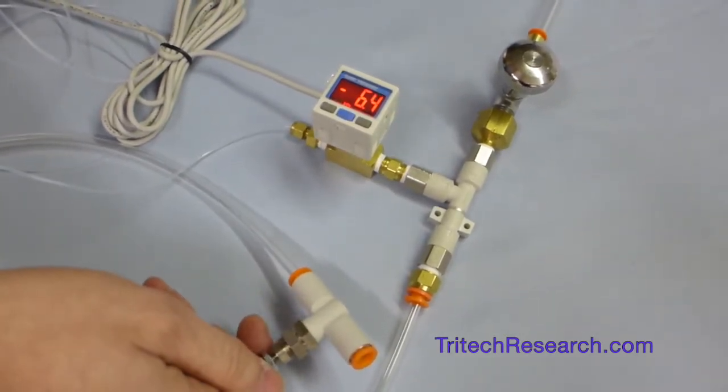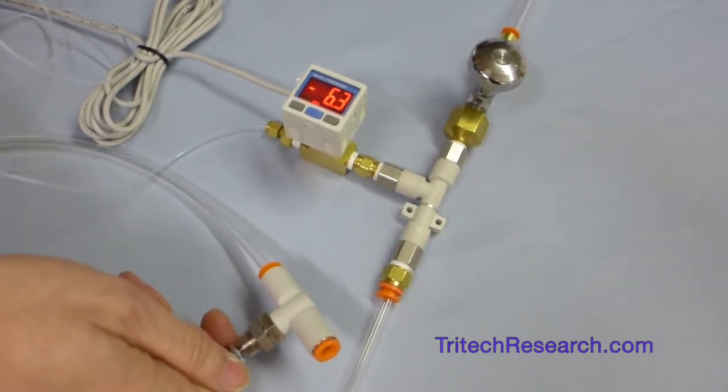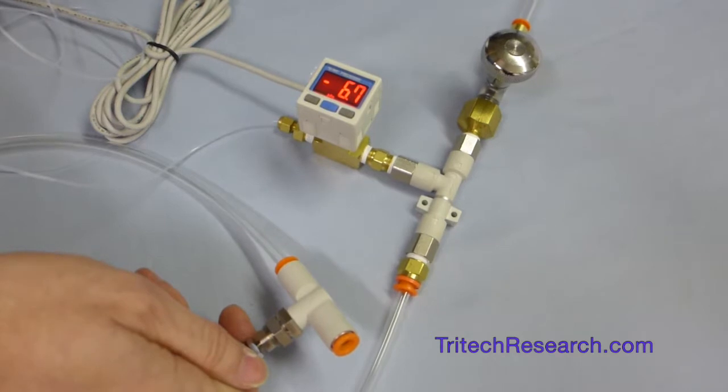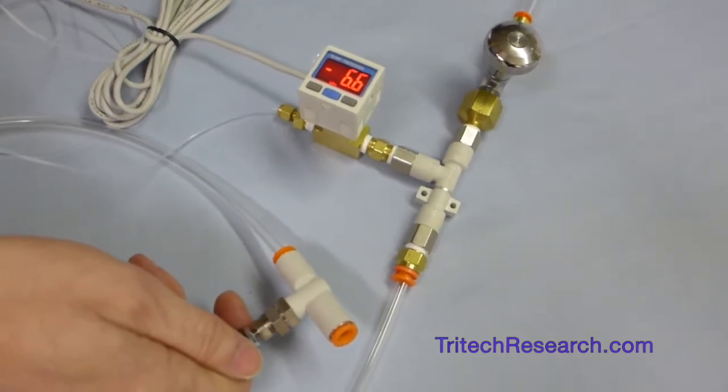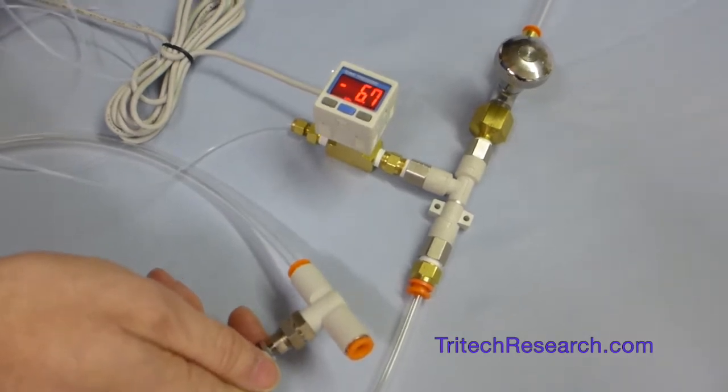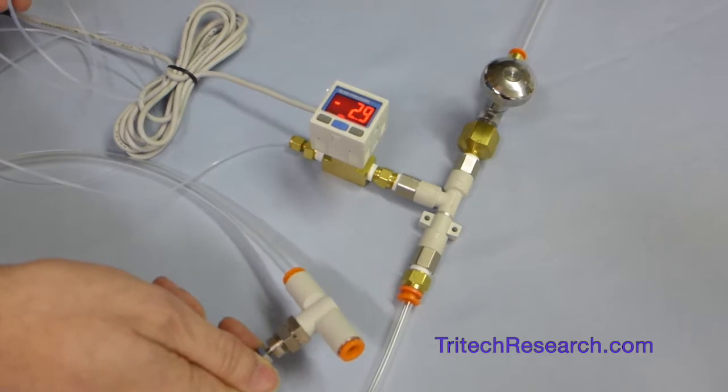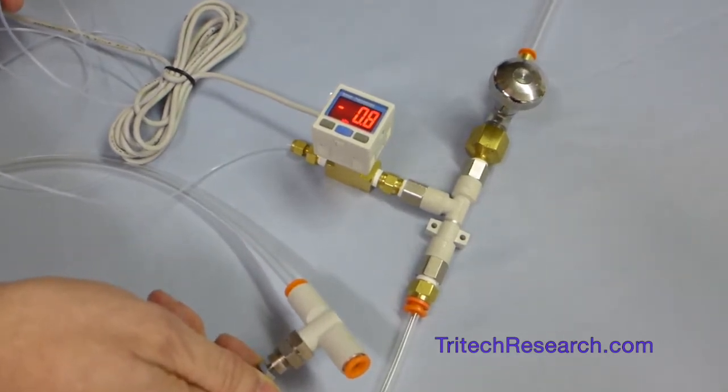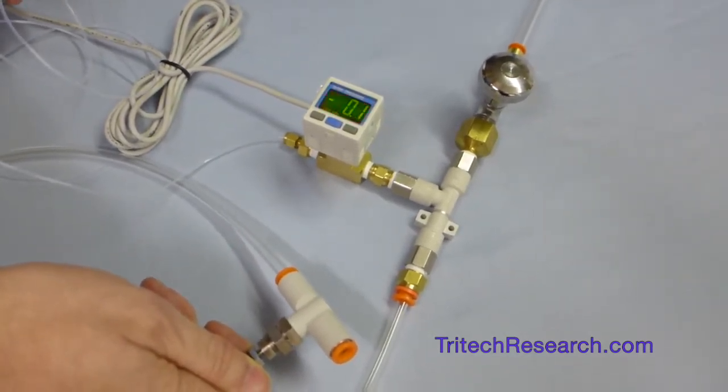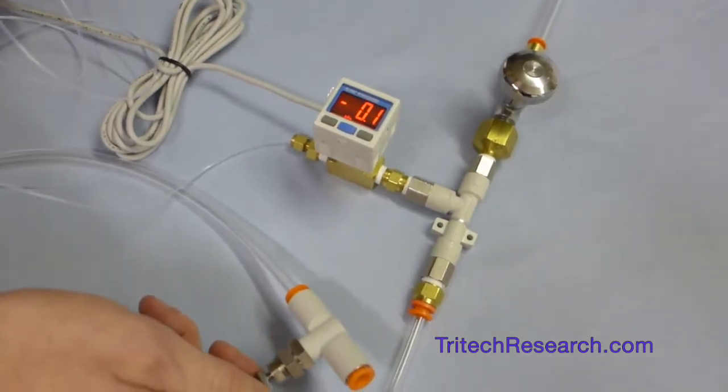So here's minus 6.8 kPa. So that's minus 1 psi. And here is pretty much zero. So it's neutral there.